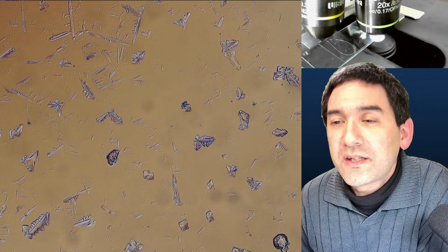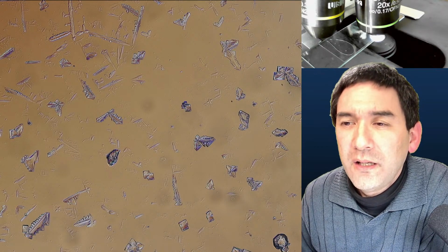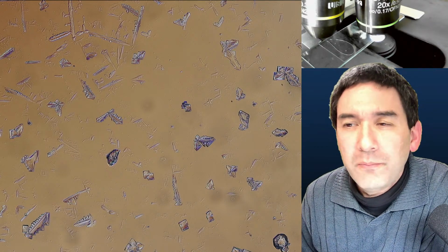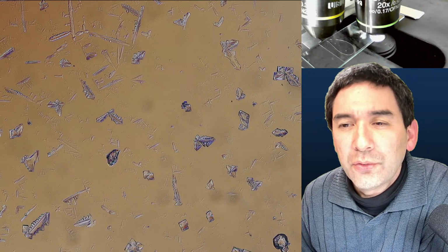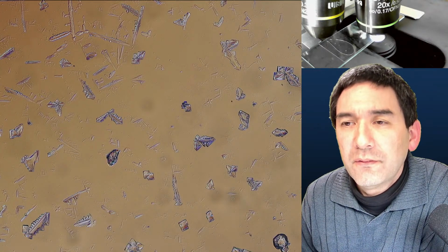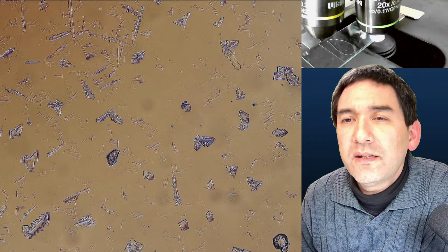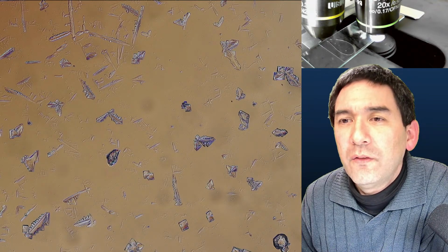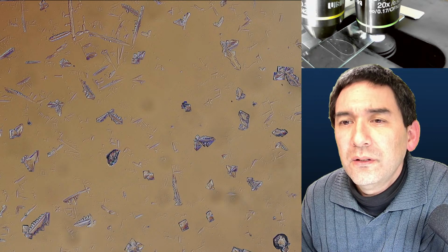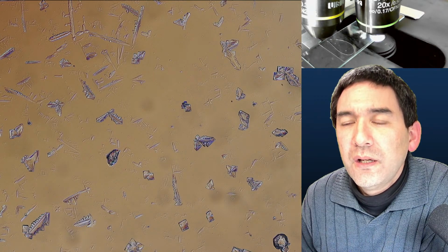Okay. To crystallize sulfur, you need toluene. Ooh, isn't this a little bit dangerous when you inhale it? But still, I don't know. Maybe acetone will work as well. I don't know. So this is something that I still have to try to figure out. Let's check if I did not forget any of the questions here. I hope there are no questions.